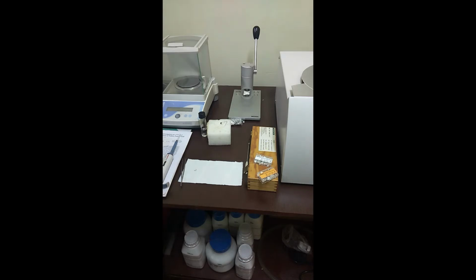So this is the crucible, and the crucible is used where after the sample is loaded in the crucible, it is covered with a lid. Now this lid, we will show you how we load the sample and how we cover it with the lid, followed by a piercing inside, so that if a particular sample is volatile, then there can occur any kind of release which is taking place. So now let's look at the sample.